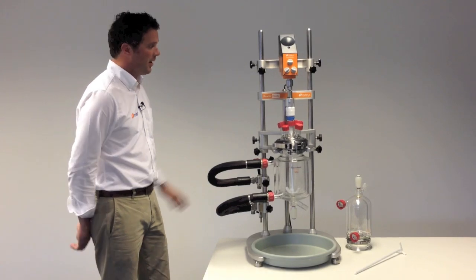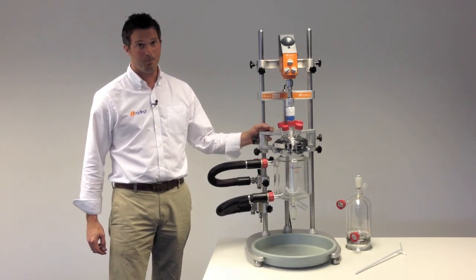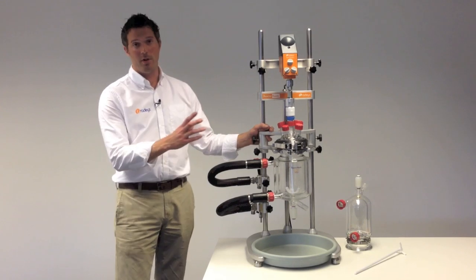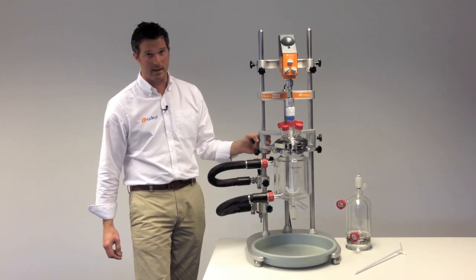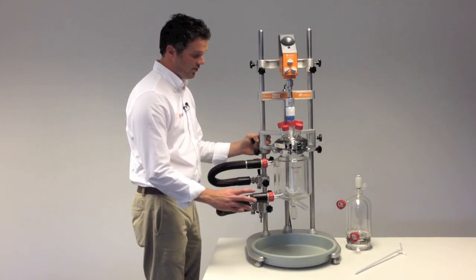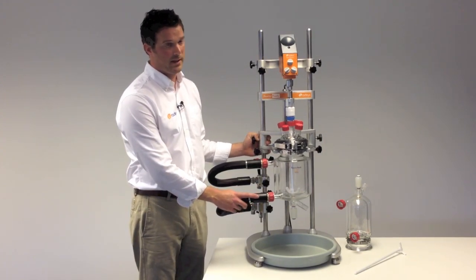Hi, I'm Ben from Radley's. I'd like to show you the Reactor Ready. This is a single universal framework that replaces the need for multiple reactor setups and accepts vessels from 100 milliliters up to 5 liters.